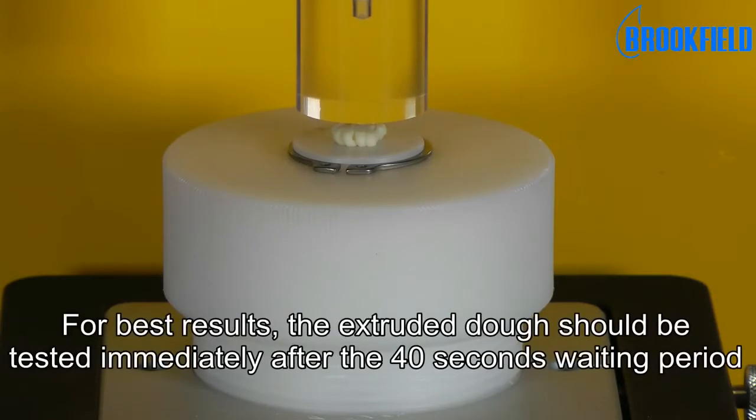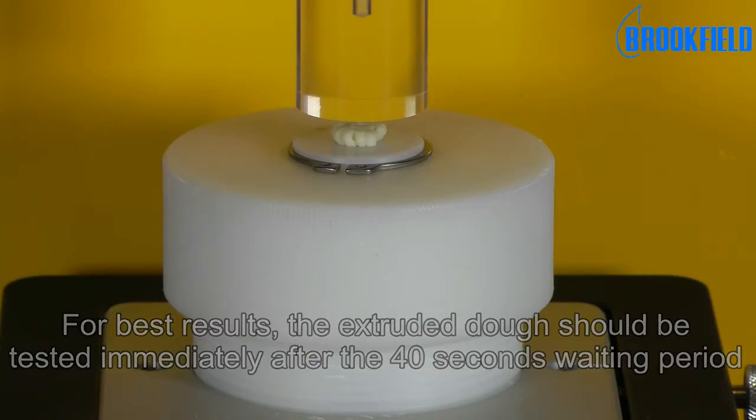For best results, the extruded dough should be tested immediately after the 40 seconds waiting period.